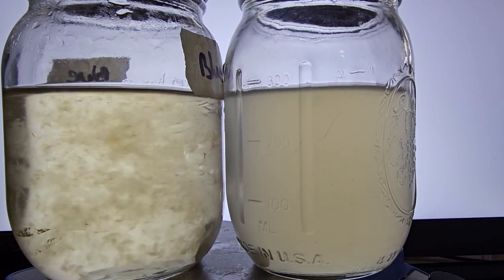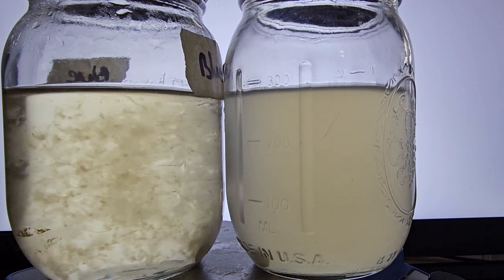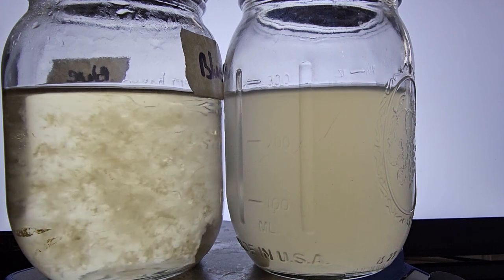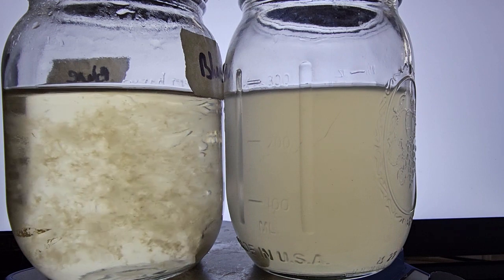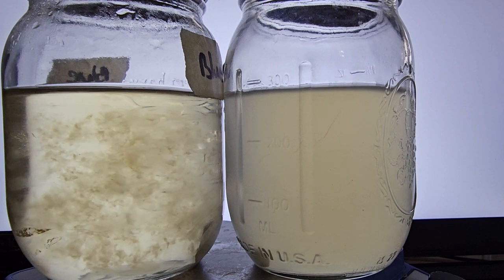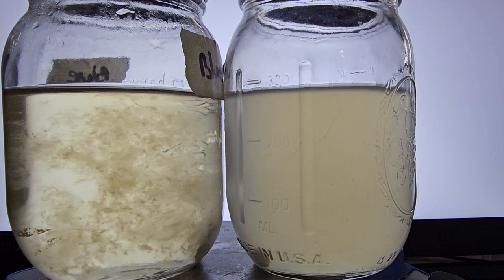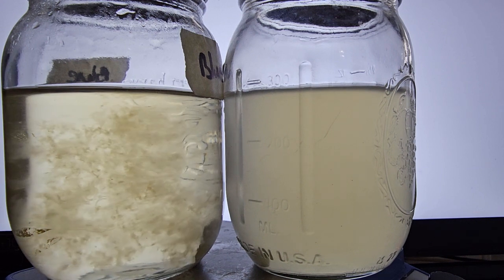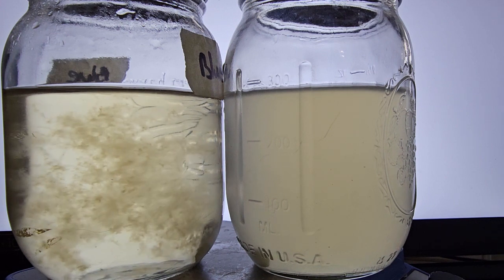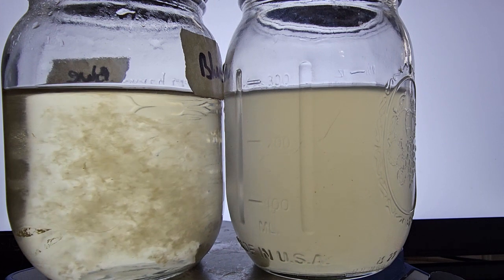And what I think is going on here is if you overcook the culture, you're actually burning the sugars that you put in there. So I use a malt extract, and that's what I think is happening. After you inject the culture and you get a cloudiness, that could be from a contamination. But this case specifically is from overcooking your jars. You don't have to cook them that long. And I just want to put this video out there to show you a very big difference. This was an experiment to show you exactly what happened here.